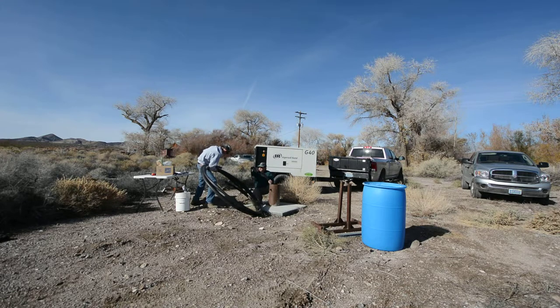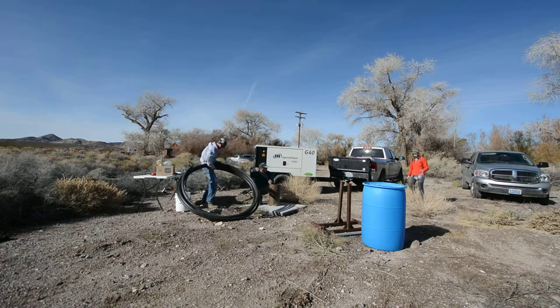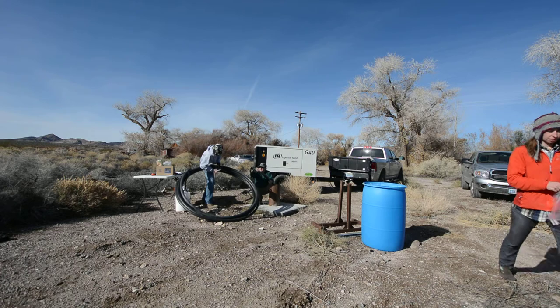Yeah, that's true. I hope the manifold got packed — did you guys see that? I just want to make sure we're using that at the beginning. In filling these canisters, I was just going to do it off the big tube here so we could do it really fast — just do it off the effluent.